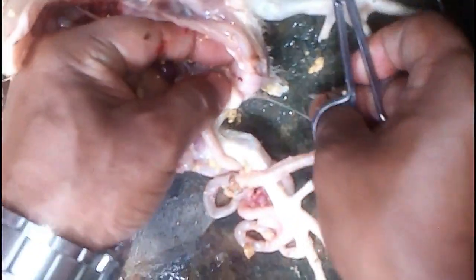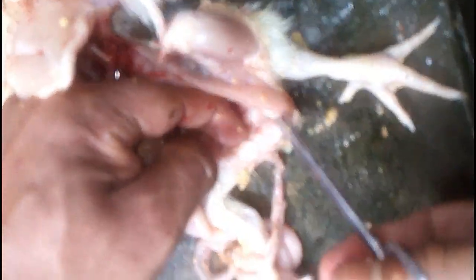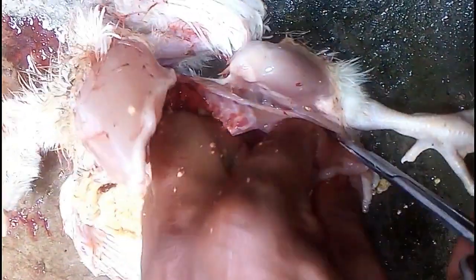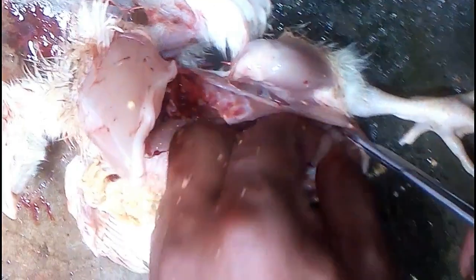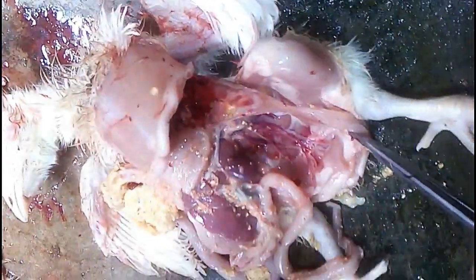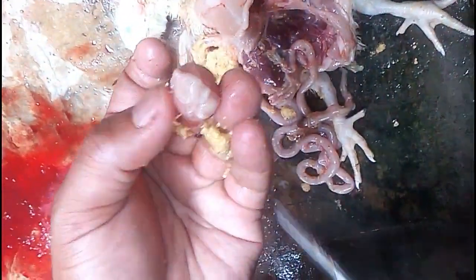Next, this is the Bursa of Fabricius — it is an immune organ of the bird. We see that it is normal size and we try to pick it out, but it is tough to pick out because it is normal and not infected by IBD virus. After opening, it is also normal.